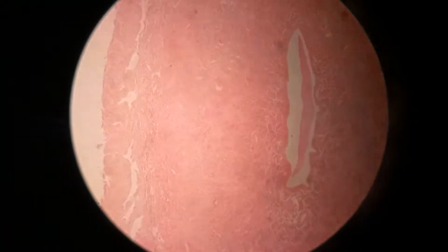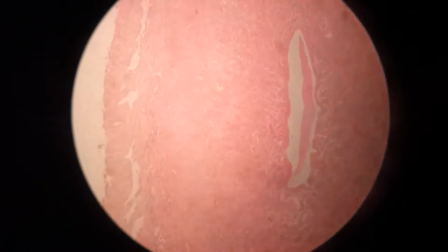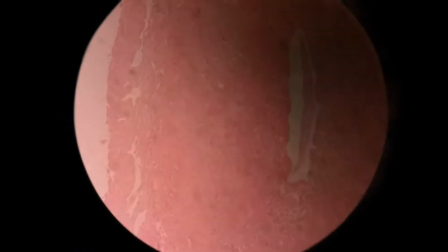Okay, the next slide is the slide of the uterus. The uterus, also commonly known as the womb, is a hollow muscular organ of the female reproductive system that is responsible for the development of the embryo and fetus during pregnancy. For the histology of the uterus, the perimetrium is the outermost layer that forms the external skin of the uterus. It is a serous membrane continuous with the peritoneum that covers the major organs of the abdominopelvic cavity.